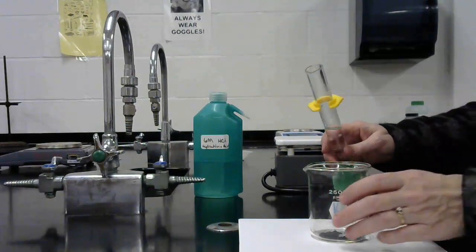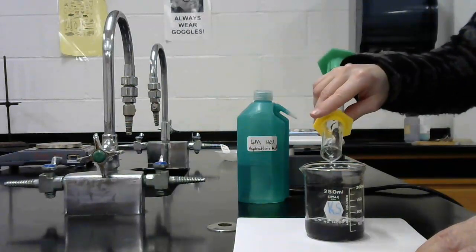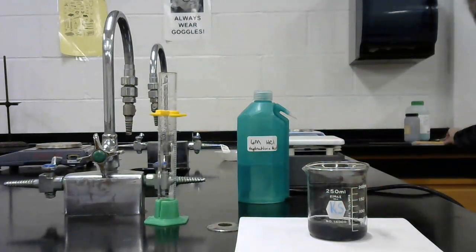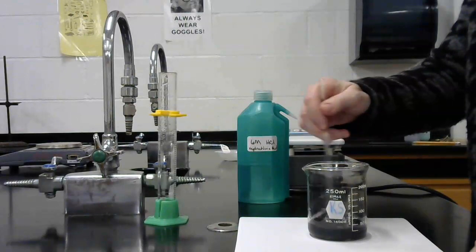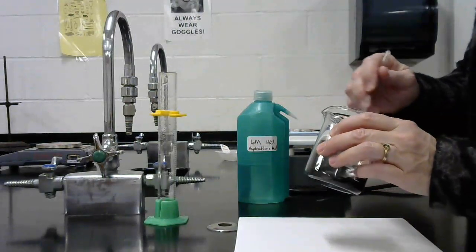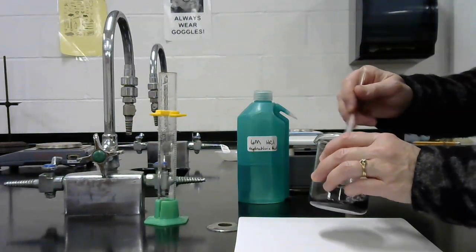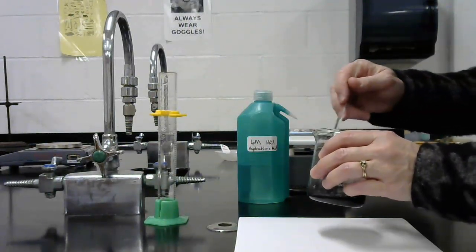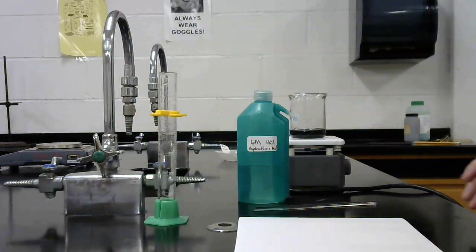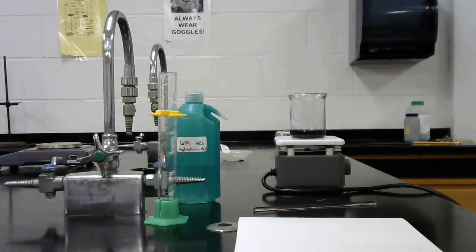So to begin with, we are going to add some hydrochloric acid to this sample to get that to dissolve. Once it dissolves, we are going to heat it, or I am going to heat it slowly to get a reaction to take place in the beaker. So this will take a little while for that to happen. So I'm going to put it on the hot plate, and we're going to let it react for a period of time. And we're not boiling it, we're just heating it very slowly so the reaction occurs slowly.